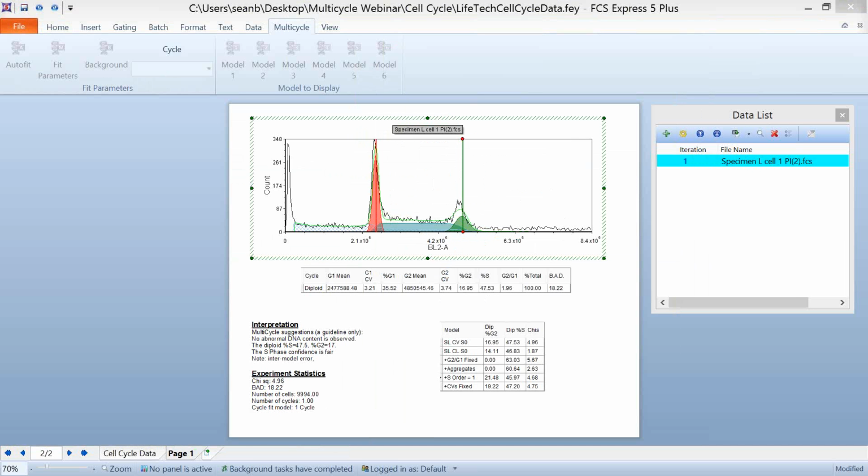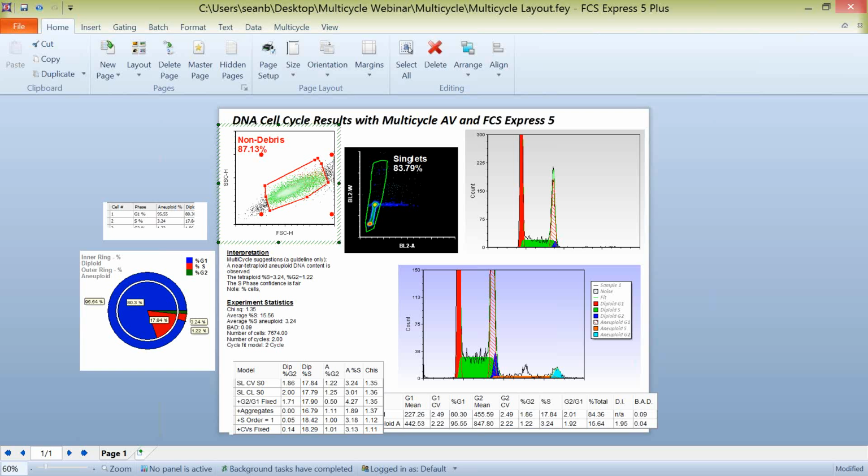Now, once you have all of this together, you can do quite a few things. You can change this formatting any way you like to come into having this really nice report, like what we're showing here on this page.